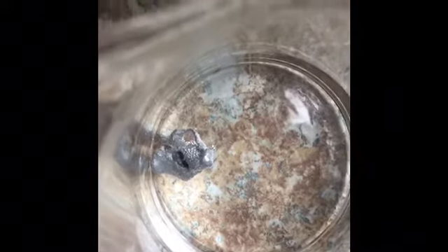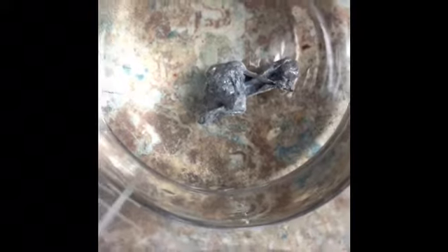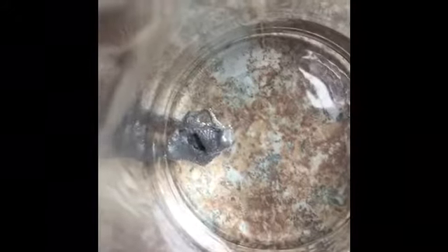So this reaction is happening slightly faster. So more diluted, less bubbles, more concentrated, we can see that there's more bubbles on there. So the reaction is happening faster.